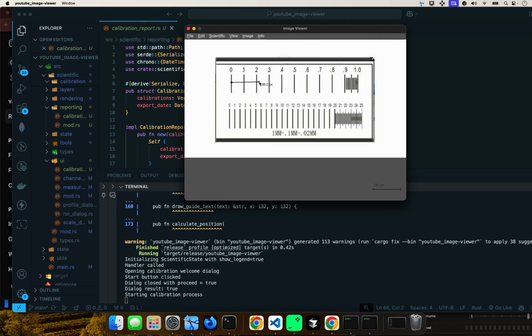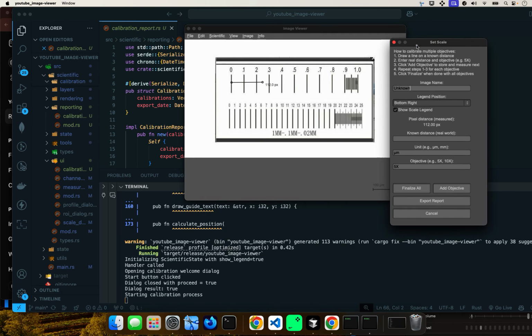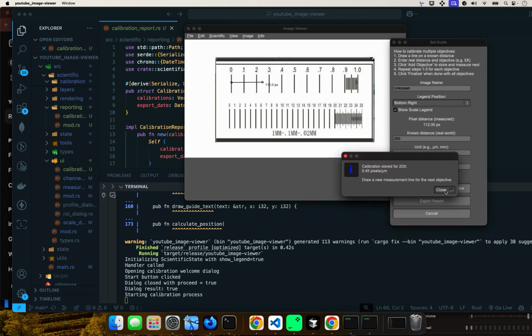Now let's do half again. So let's say 250. It's not going to be exact. This is just a proof of concept. And again, we'll do 250 microns. And then this will be the 20x objective. We're assuming this is a microscope. This is how you would be calibrating an image, matching the image coordinates with the screen coordinates using the stage micrometer. So that will be add objective.